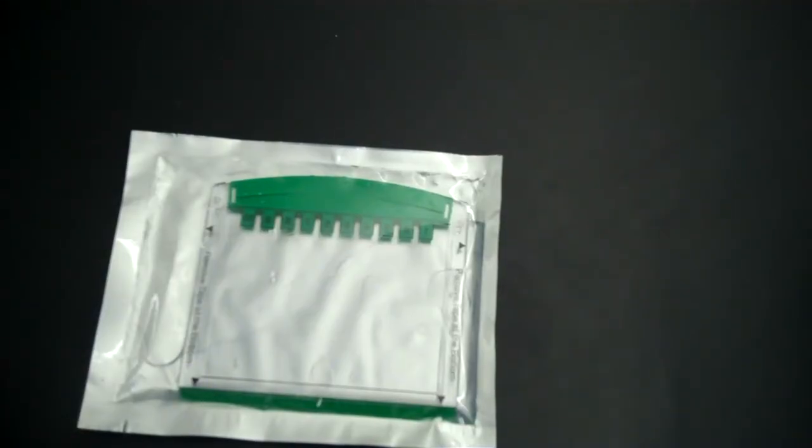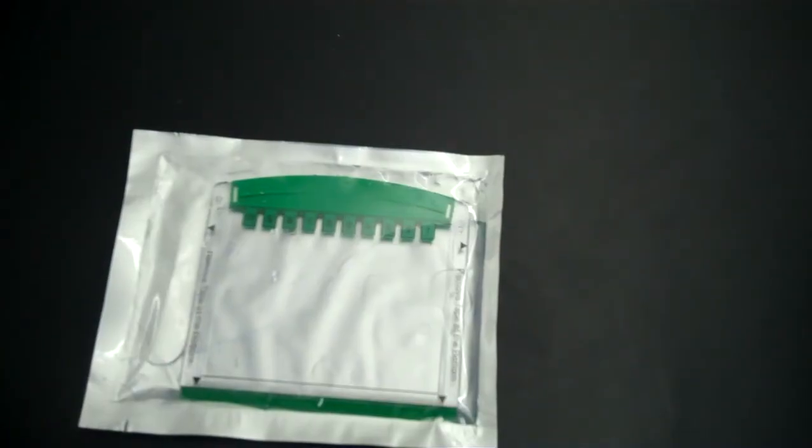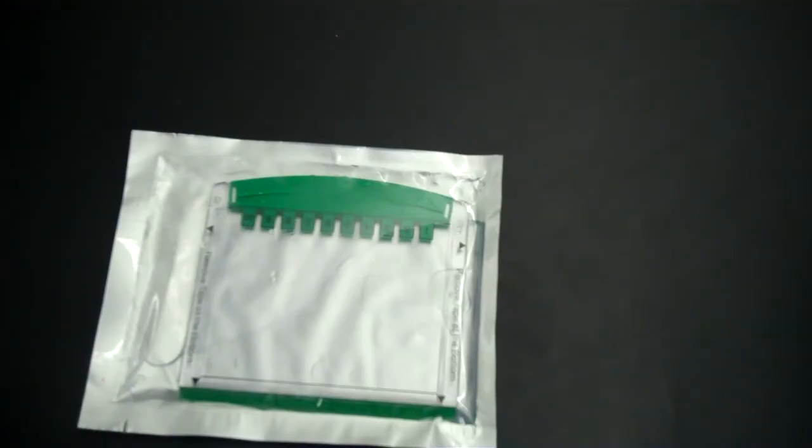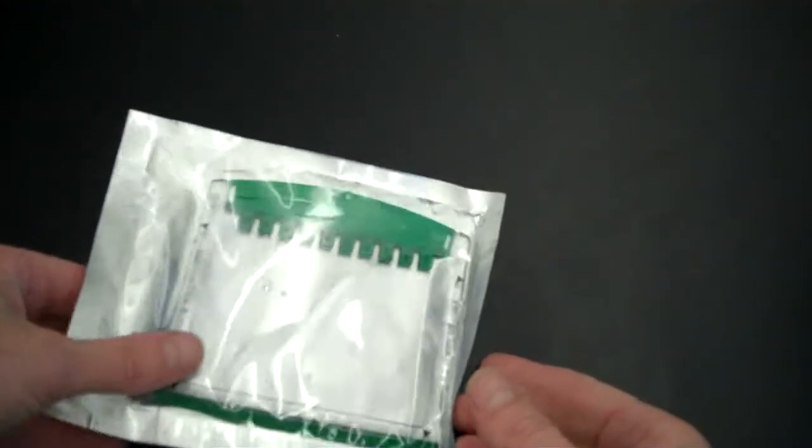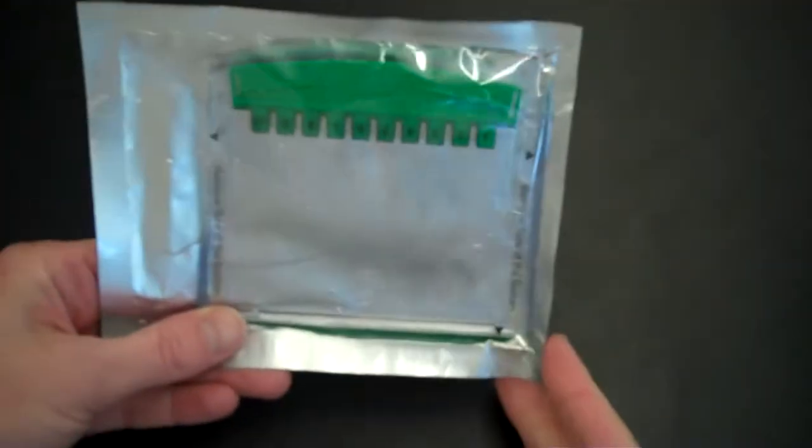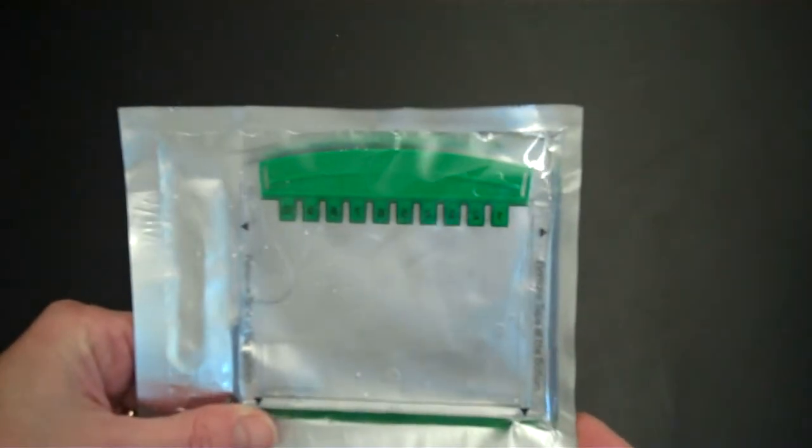In this segment I'll be showing you how to set up your SDS page electrophoresis. In order to begin, the first thing that we need to do is take care of our gel. The gel is pre-prepared and you'll find it in one of these packages.